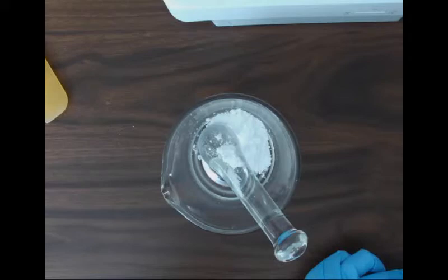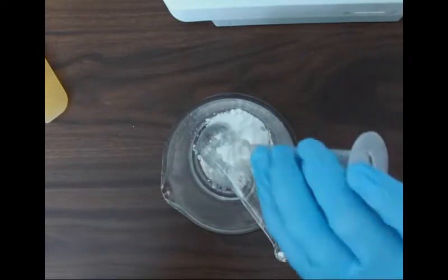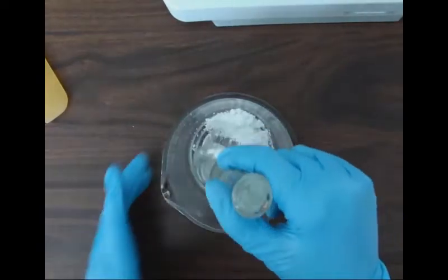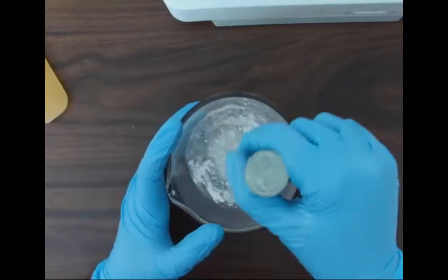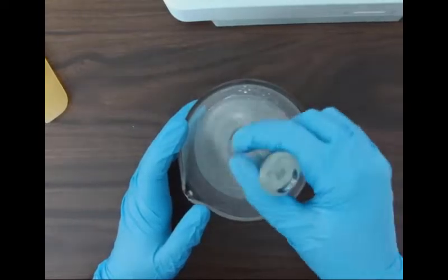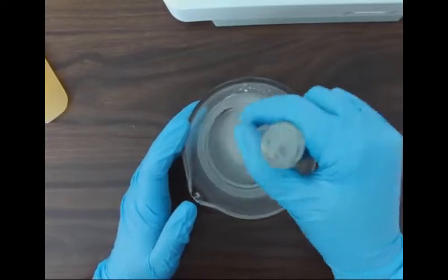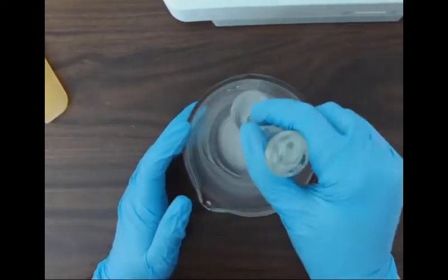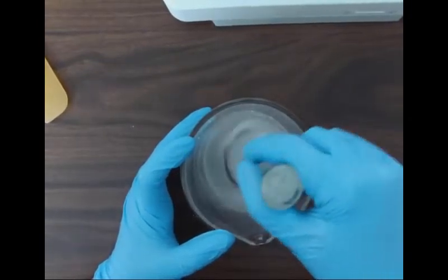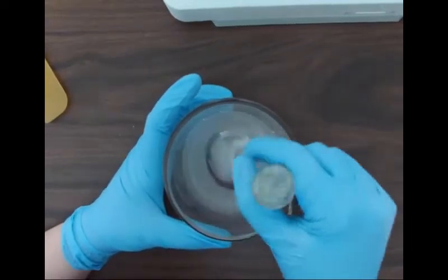Okay, so I'm going to be measuring out my ethyl alcohol here to use as my levigating agent to make a paste. Just following that formula's instructions. Okay, and it's okay to add it all at once. It doesn't specify to add in portions. So I'm just going to mix that together until it's all dissolved. We don't really want clumps of powder. So our rules for geometric dilution don't apply to this compound because we're basically mixing a powder into a liquid. And there's a really cool thing that you'll see when we add those.